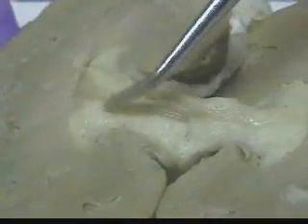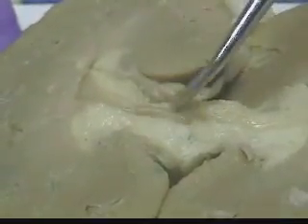Those are collecting cups. And in this region here is where you have the renal pelvis, and then the renal pelvis actually collects more urine, and then it takes it through to the ureter. And here again is the ureter. This concludes our kidney dissection.